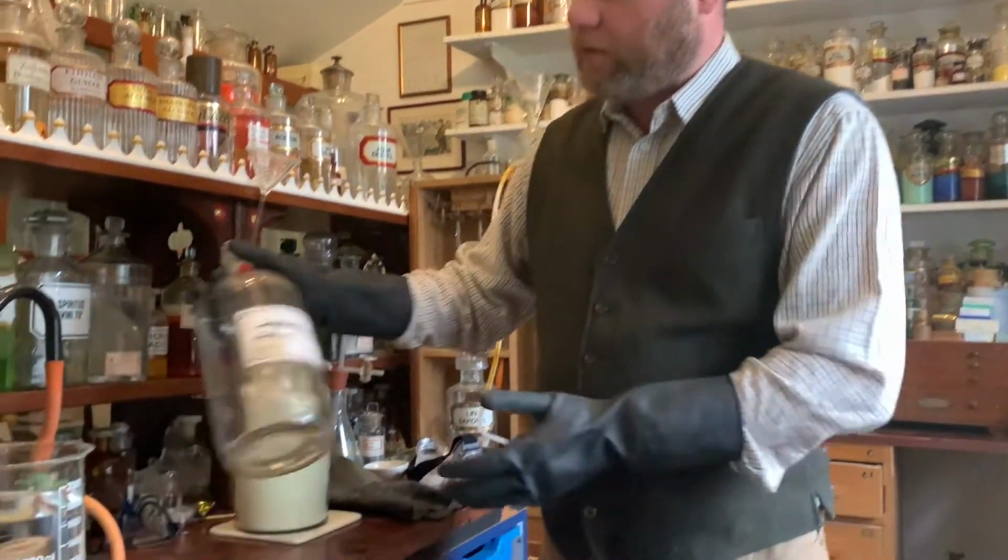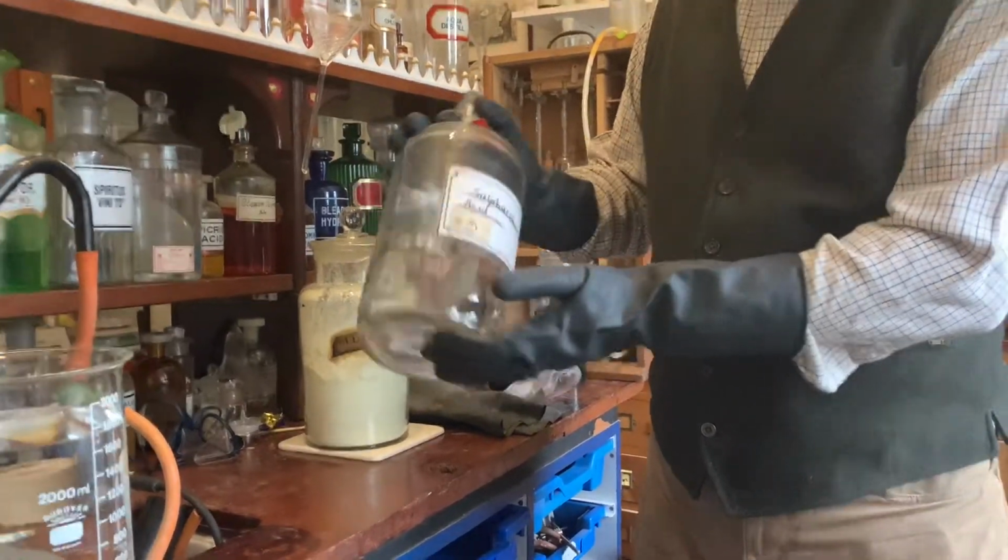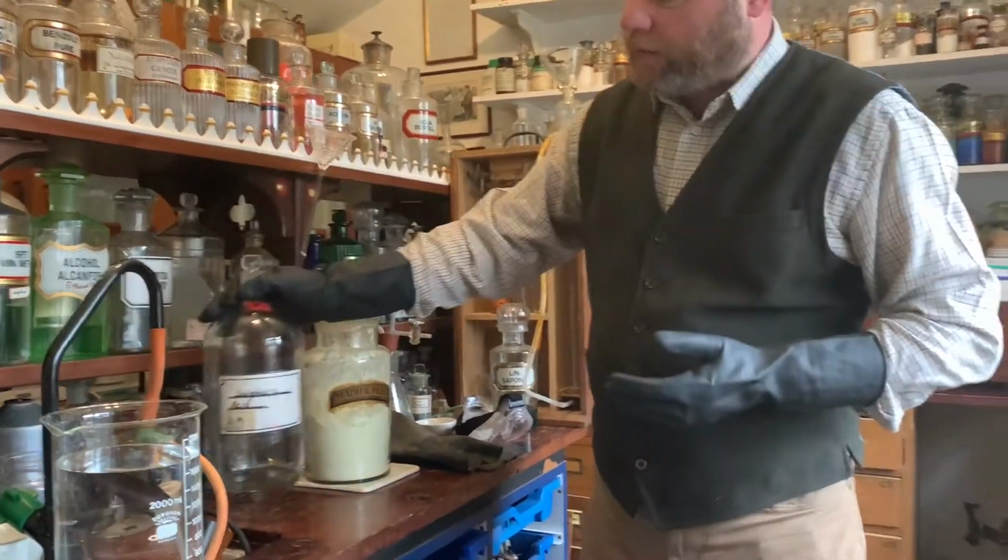Now to do that, we're going to need some dilute sulphuric acid. And as you can see, I'm out of dilute sulphuric acid. And in another future video, I'm going to show you how to safely prepare a molar solution of sulphuric acid. So what I thought I would do is show you the dangers of concentrated sulphuric acid.